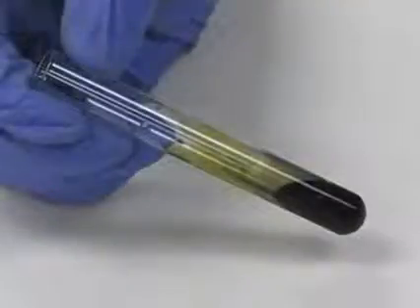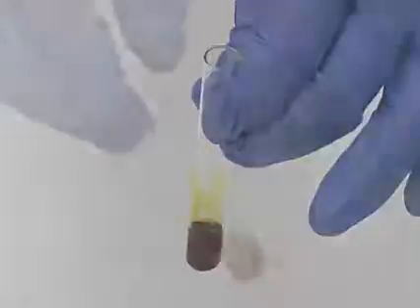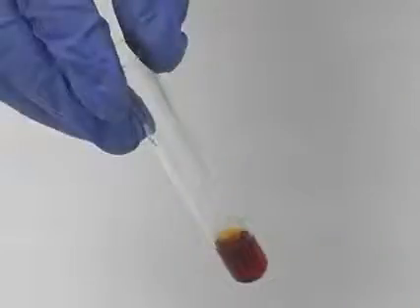The color of the solution in the test tube immediately changes from dark amber to bluish black or very dark blue. The negative tests with sugar and DI water show no change in color and remain amber when Lugol's solution is added to them. Now, take a look at the result shown by our unknown solution for the Lugol's test. Does it contain starch?